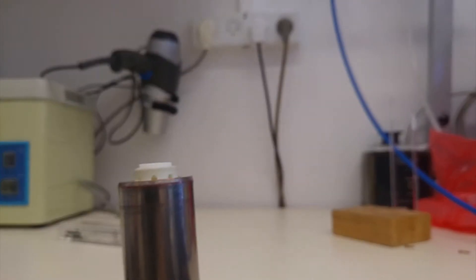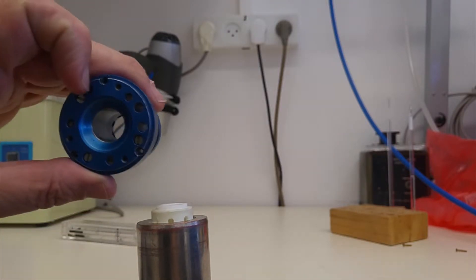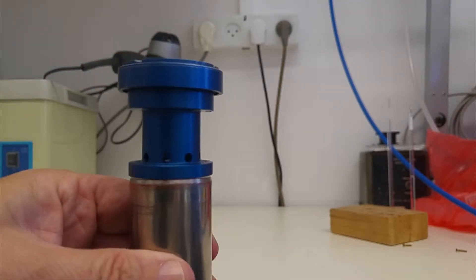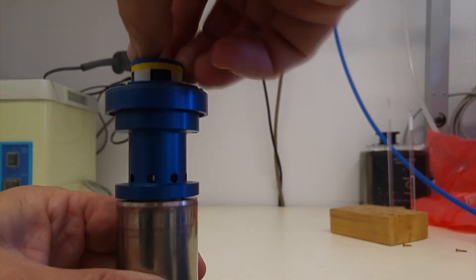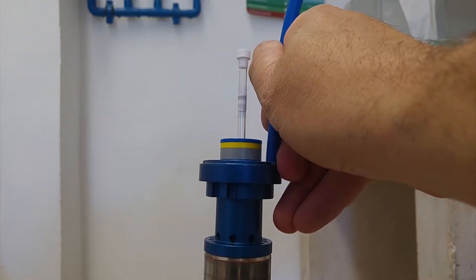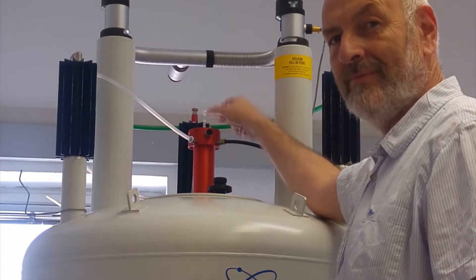It sits in a probe, and on top of the probe inside the magnet sits a turbine. If you look at the center ring there, there are some very small holes that spin the sample. The sample drops into the magnet gently and rests on the turbine. It's called a spinner because we can use compressed air on the turbine to spin the sample. The sample can then be ejected and removed using a column of air.